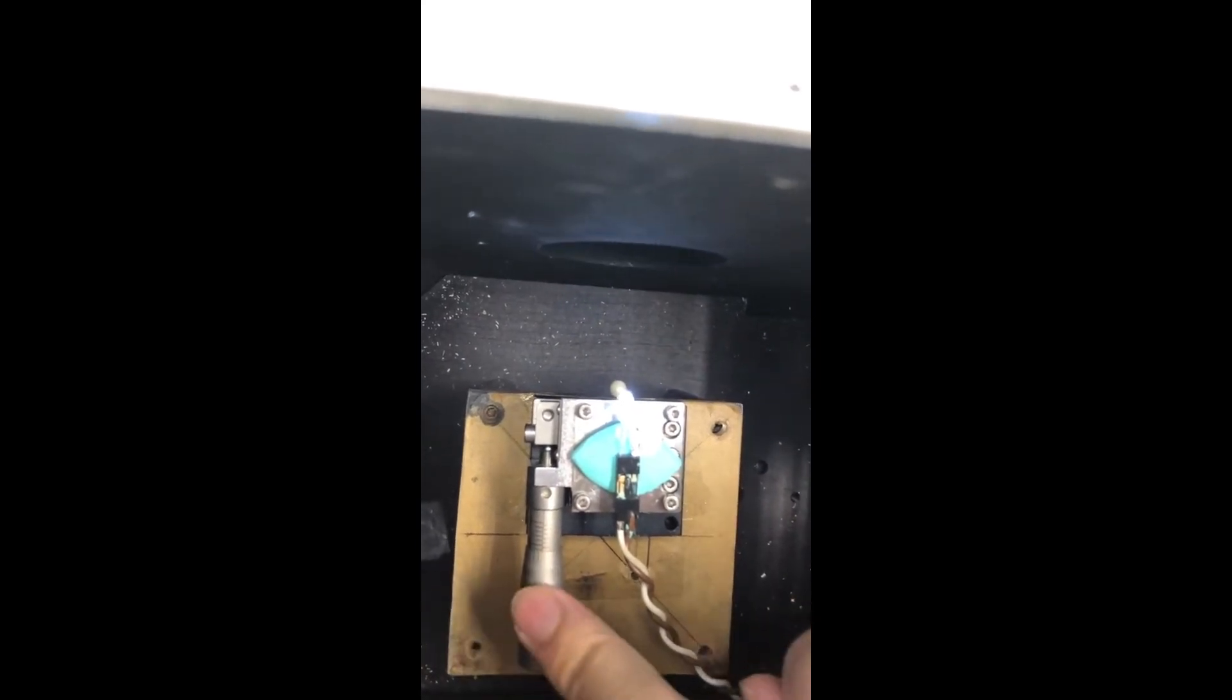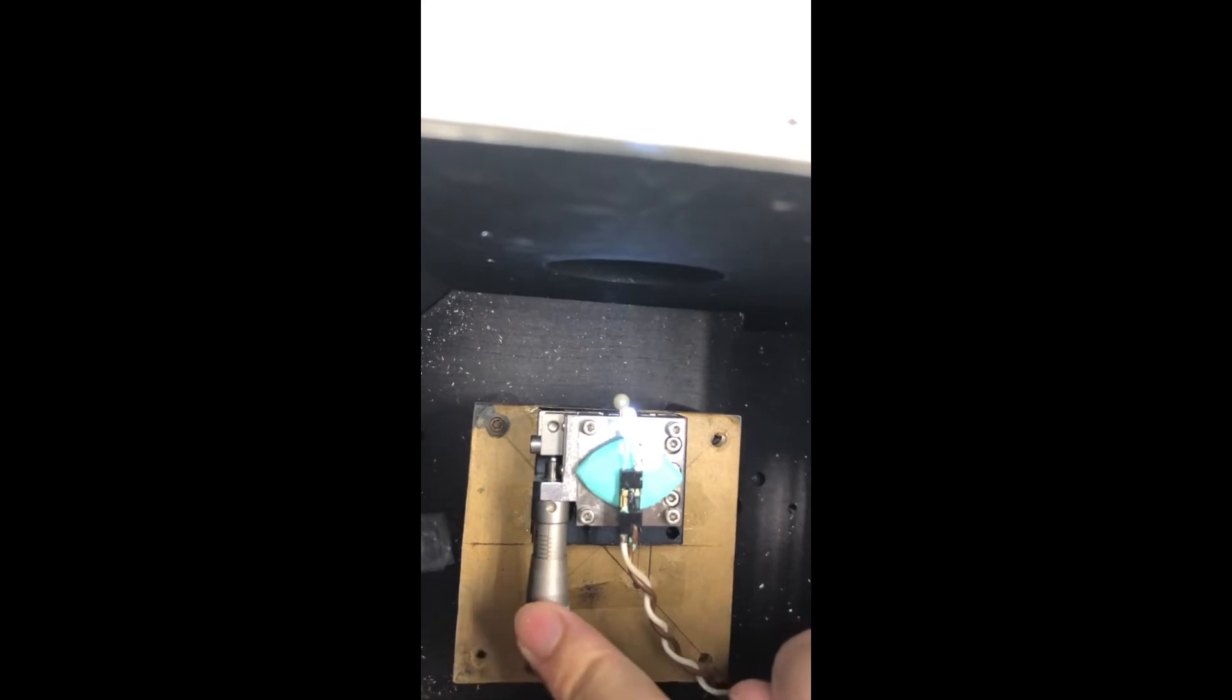In the middle, a little bit more. Now we have the LED in the middle position.